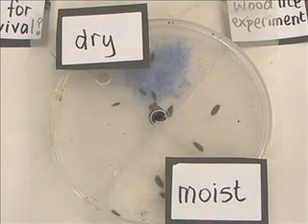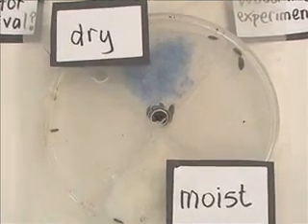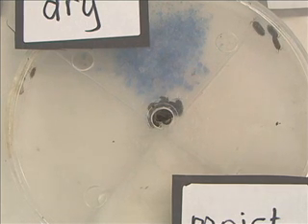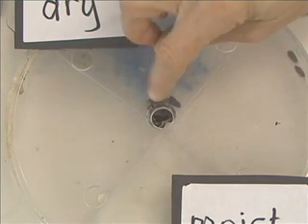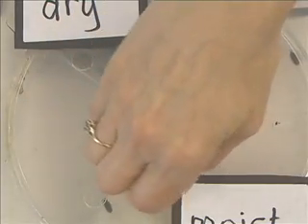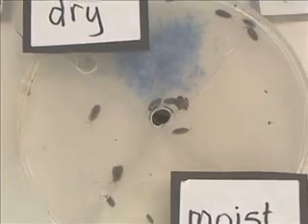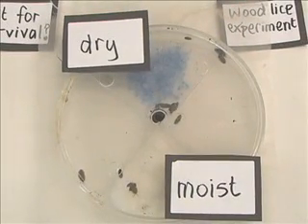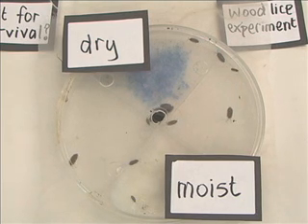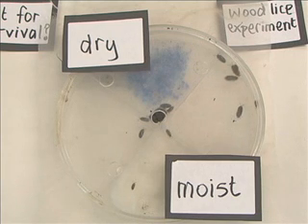Now we'll give them a moment just to explore and have a look around, and then once we think they've all moved away from where they were put, just encourage them to move away and break up any little bundles. In order to count how many woodlice are in each section, every minute for five minutes we make a note of how many are in each of the special areas. We would then add up the totals to get a score for each area.